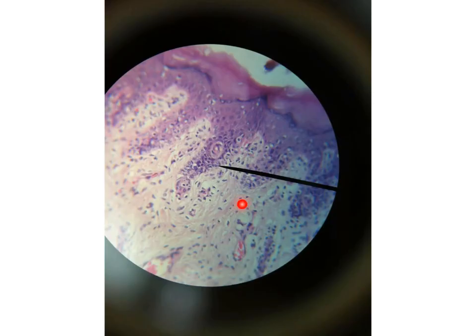Also, this is another picture for the epithelium. This is the epithelium and this is the connective tissue. The word epithelium means it is present above connective tissue. Thelium is a connective tissue. Epi means above. This type of epithelium is formed of many layers of nuclei, so it is stratified. The top layer is flat, so it is stratified squamous, and it is covered by the homogeneous red material of keratin, so it is keratinized stratified squamous epithelium.